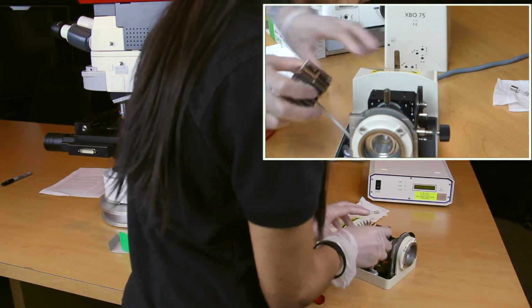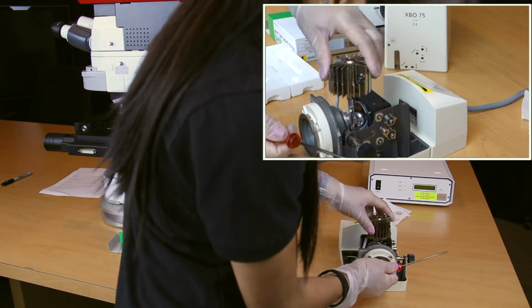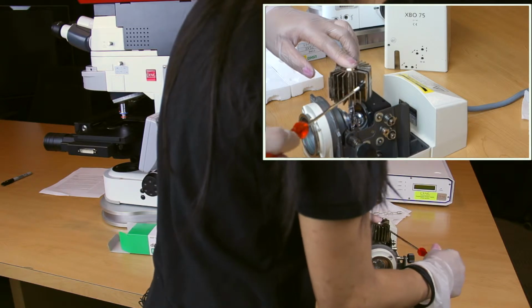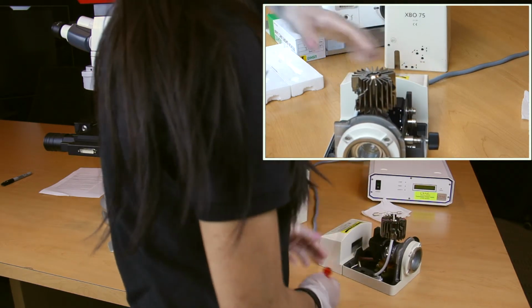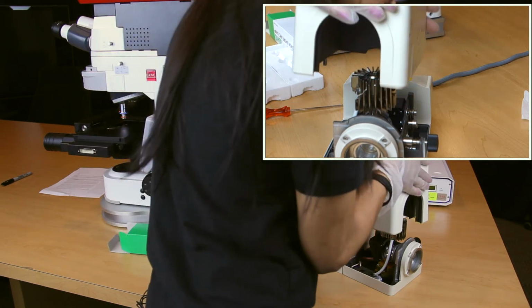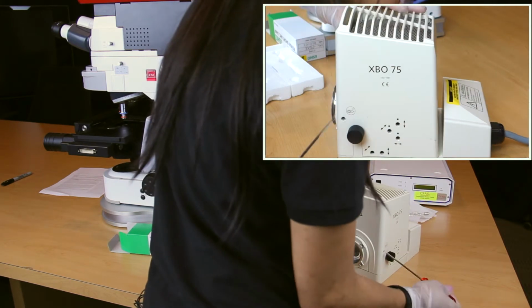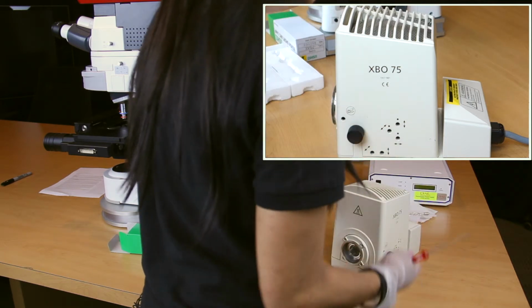Once it's situated, you also want to put the heatsink back on. And in order to do that, you just want to gently cap the Xenon bulb, push down until it stops, and tighten the screw so that it stays on the Xenon bulb itself. So once that's set, you want to go ahead and take your Xenon cap back on, slowly slide that back onto the lamp housing itself. And make sure you always tighten the cap until it's secure.